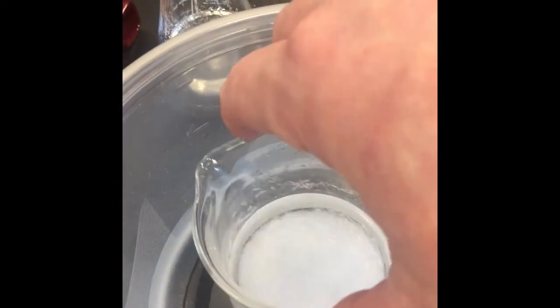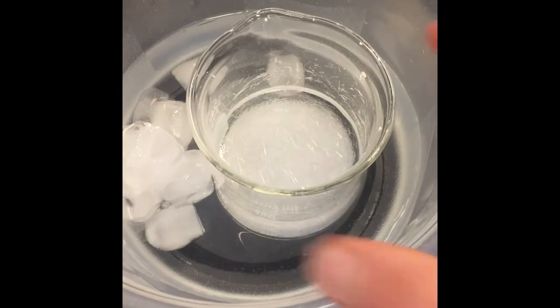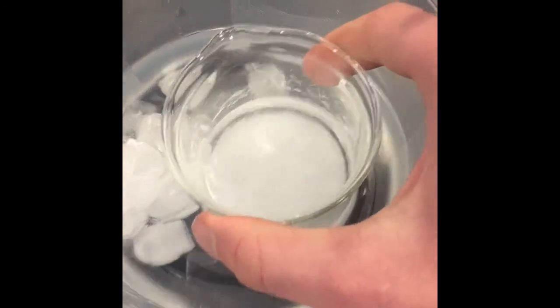And after cooling to room temperature we have lots of lovely crystals. We will collect those shortly. So now we have our recrystallized salicylic acid.